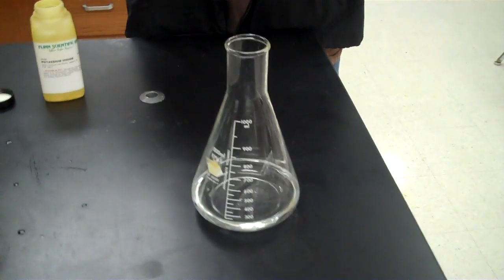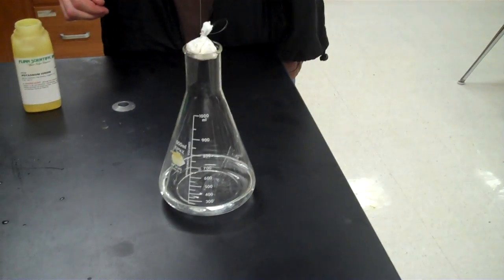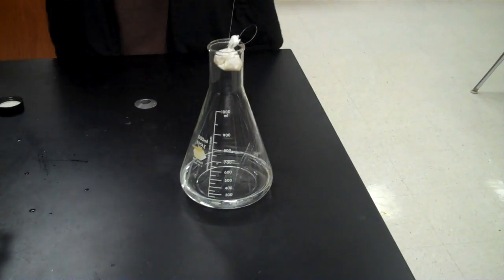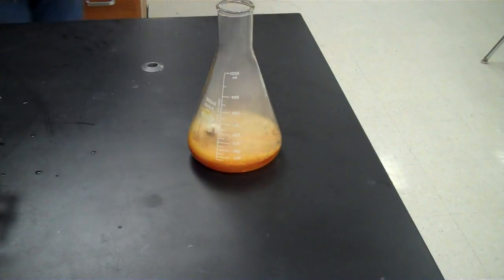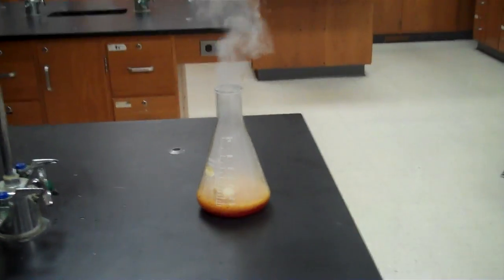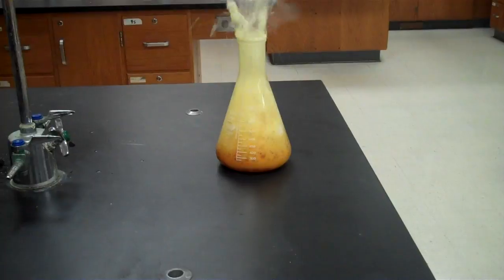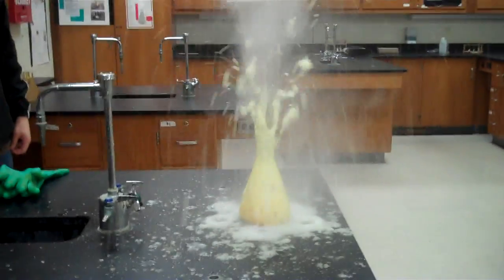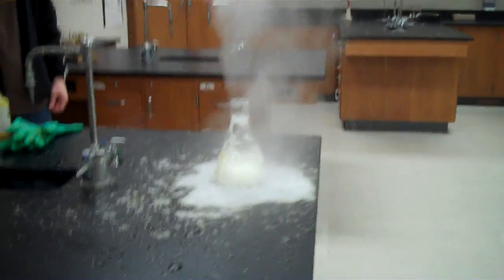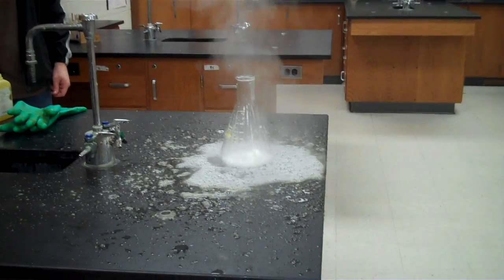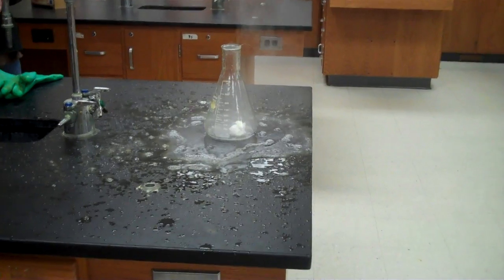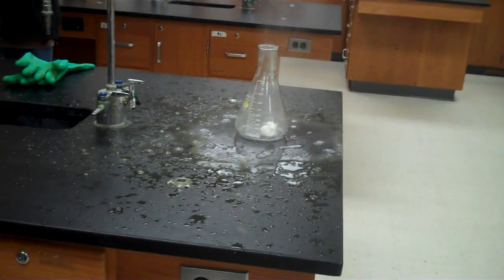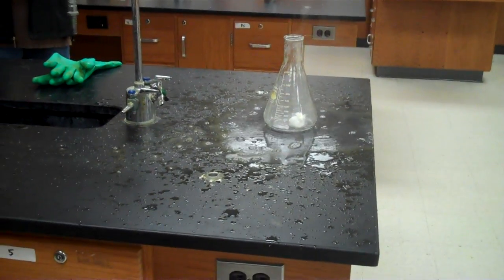And, as we will put it in there, the reaction will occur. A decomposition reaction. As you can see, it violently reacted anyway, so I guess that pouch really didn't matter.